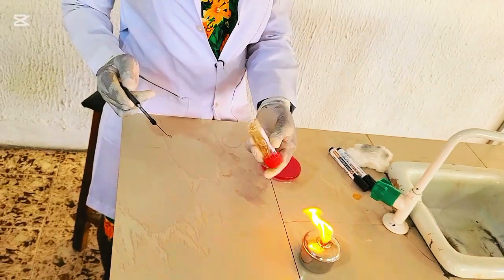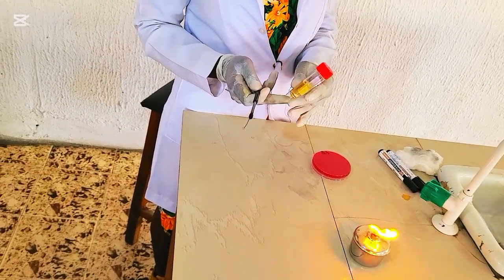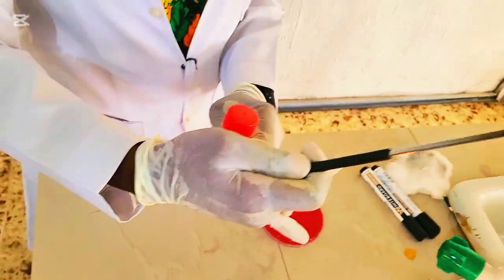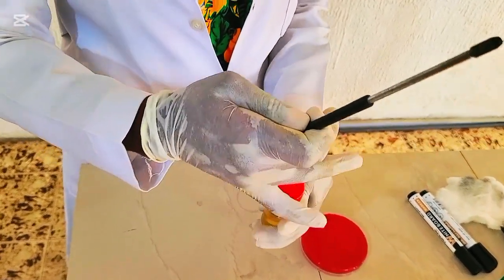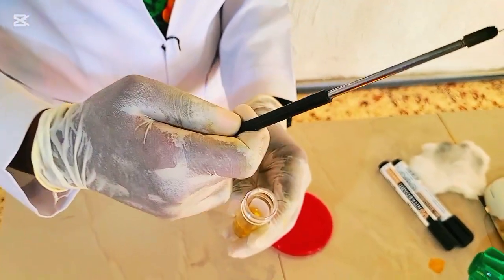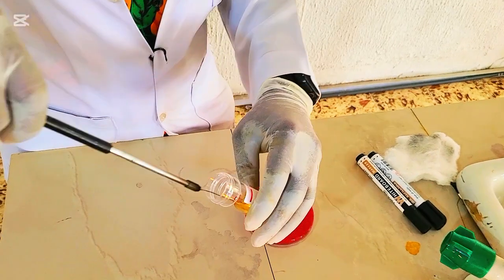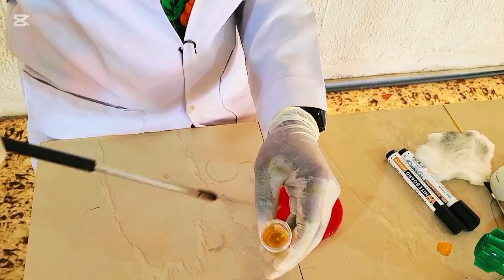you mix your sample properly, because sometimes if there are bacteria, if there are microorganisms, they may have settled down. So you want to mix your urine very well, and then with these two last fingers, you open the lid of the universal container, and you don't drop it so you don't contaminate the sample. While holding it like this, you dip to get a loop full. So this is a loop full of this urine sample.